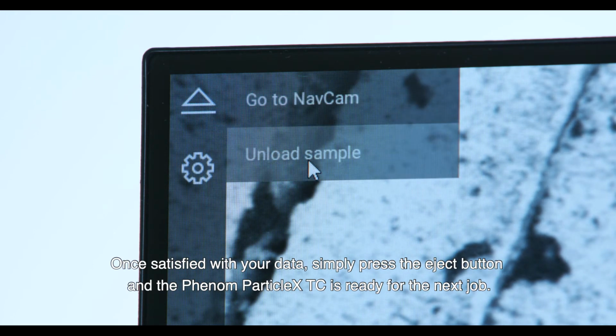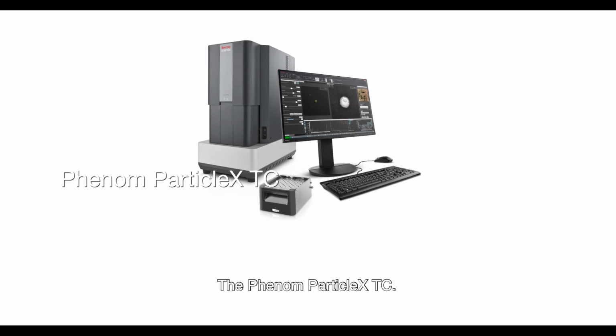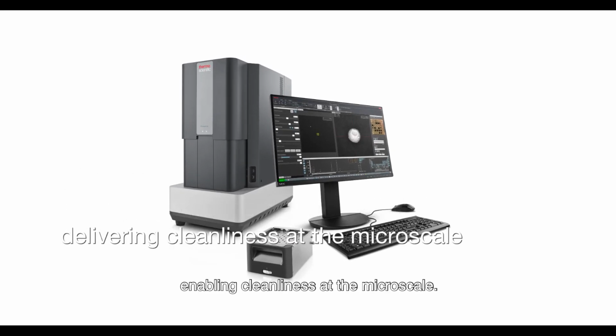Once satisfied with your data, simply press the Eject button and the Phenom ParticleX TC is ready for the next job. The Phenom ParticleX TC, the multi-purpose desktop SEM, enabling cleanliness at the microscale.